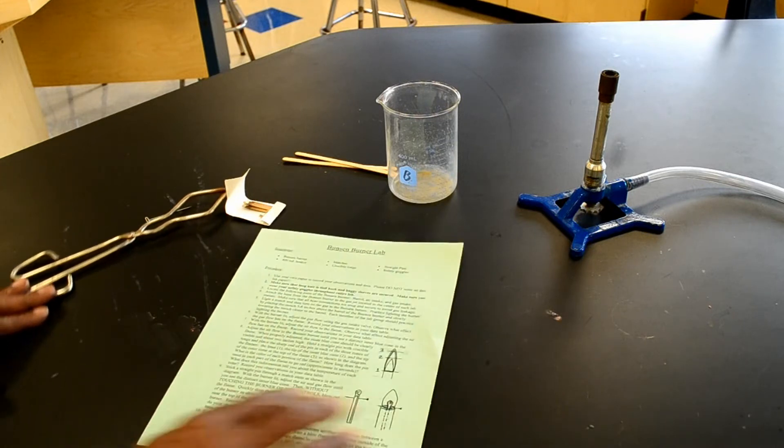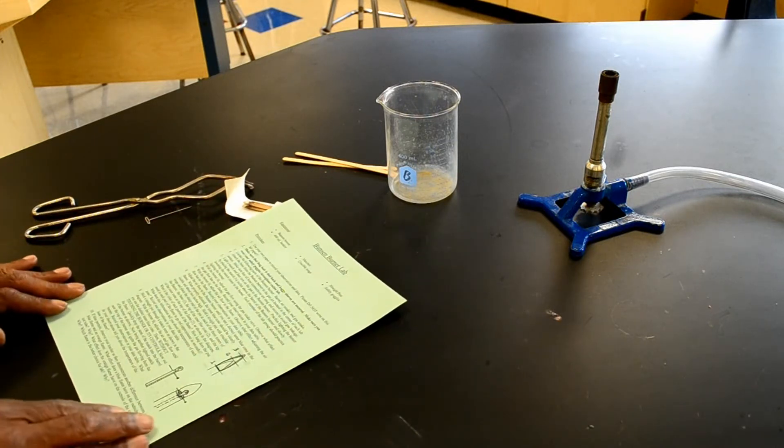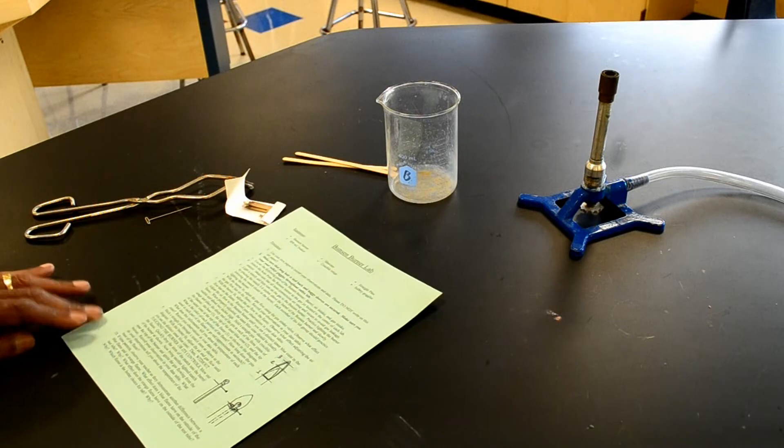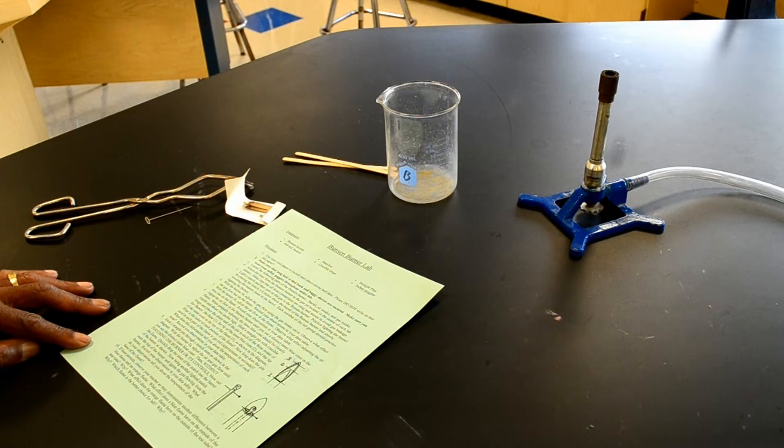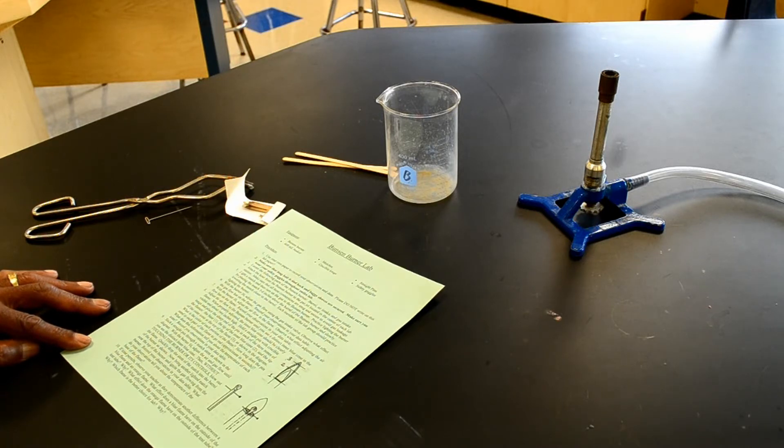Reading from the lab, we're asked to use your own paper to record the observations and data. Please do not write on this lab paper. Make sure that long hair is tied back and baggy sleeves are secured. Make sure you wear your safety goggles throughout the entire lab.